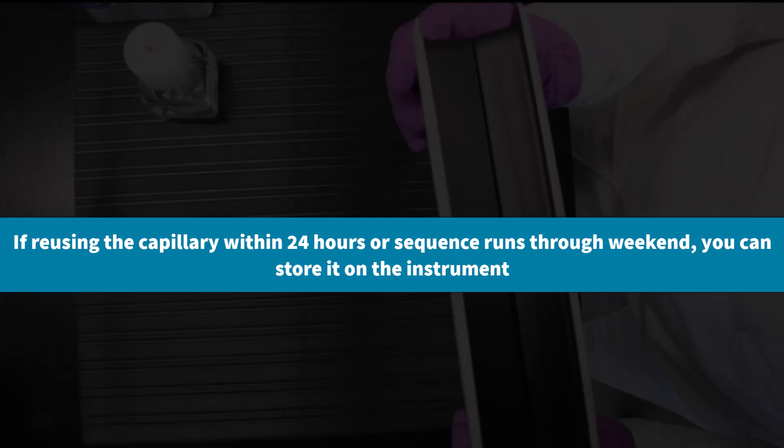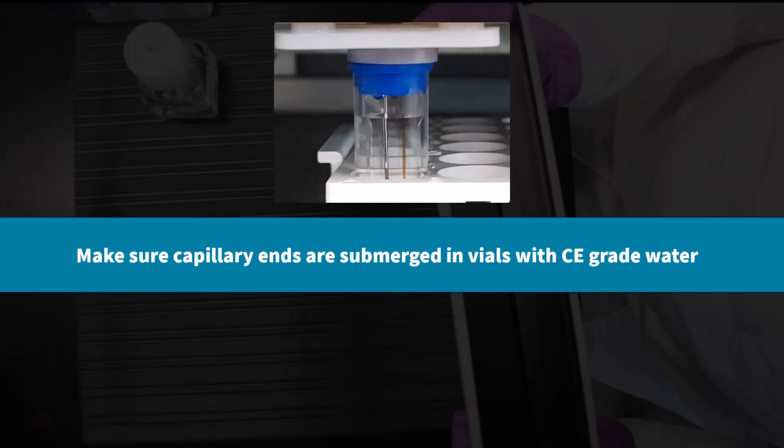If you choose this option, be sure that your capillary ends remain submerged in vials containing CE-grade water.